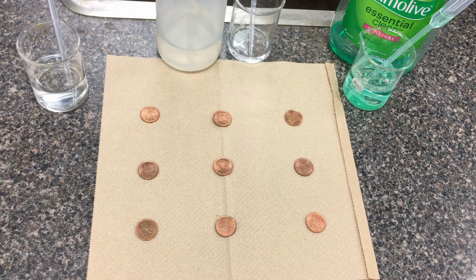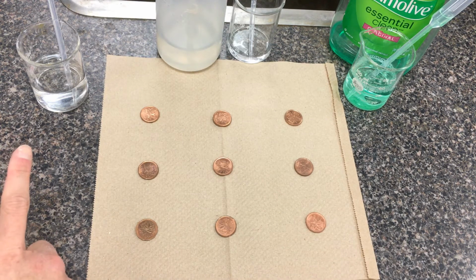So for example, my thermometer here is reading 20.0 plus or minus 0.5 degrees. You still record that down as your control so that if someone questions your results later on, you can actually mimic and repeat your procedure again. So the way we're going to do this is I'm going to individually take the solutions. We're going to start off with water.